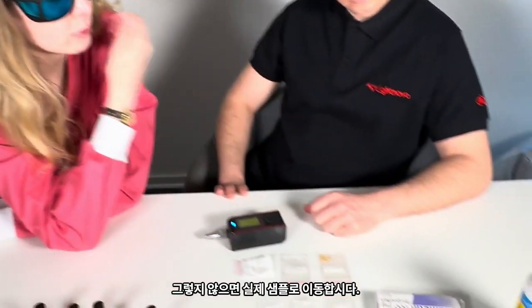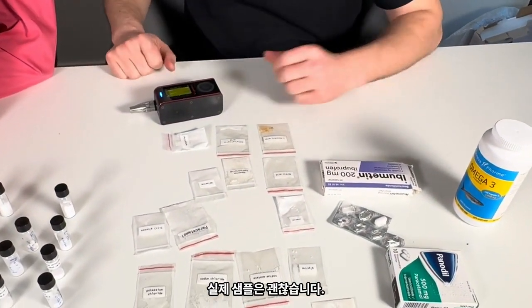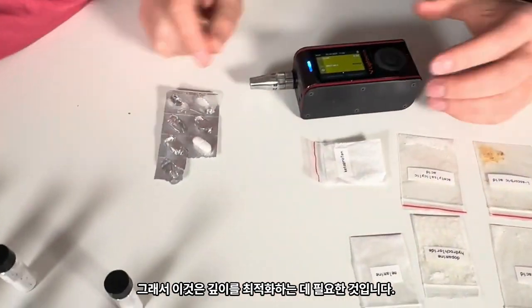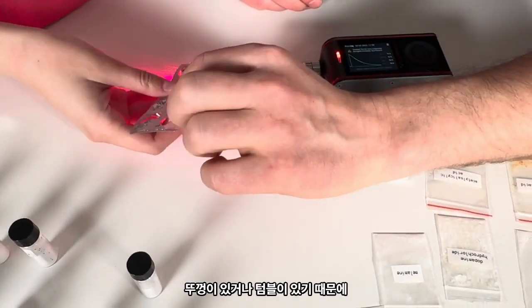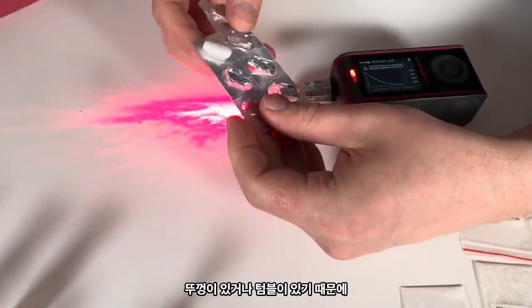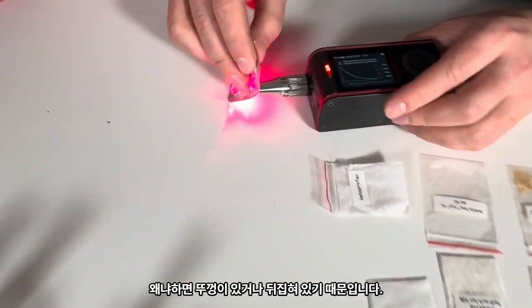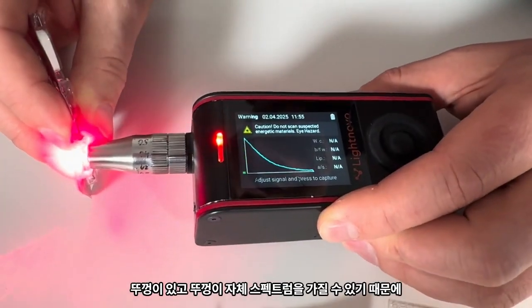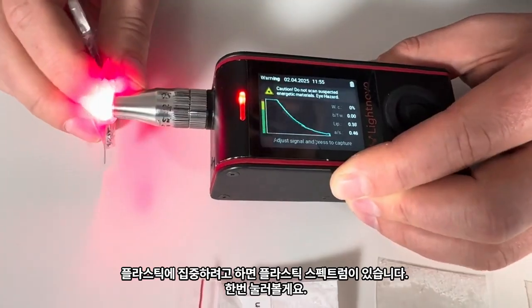Maybe let's move to real samples. Real samples. Okay. Yes. So this is something that we need to optimize the depth because it has a lid. Paracetamol, yeah? It has a lid, and the lid would have its own spectrum. So if I would just try to focus on the plastic, there is a spectrum of plastic. Sorry, let's try to press against.